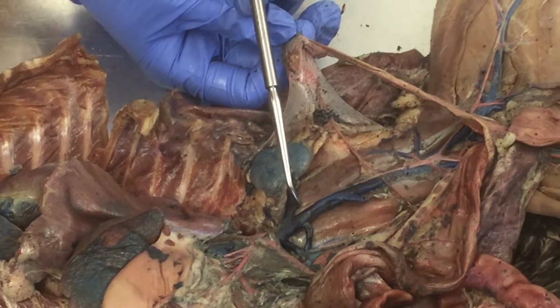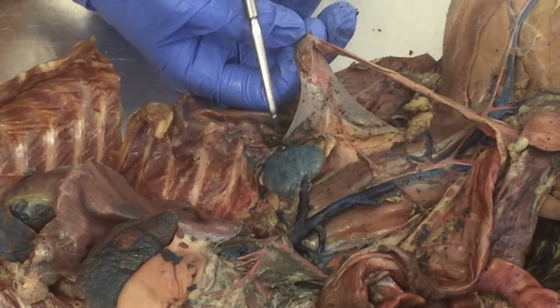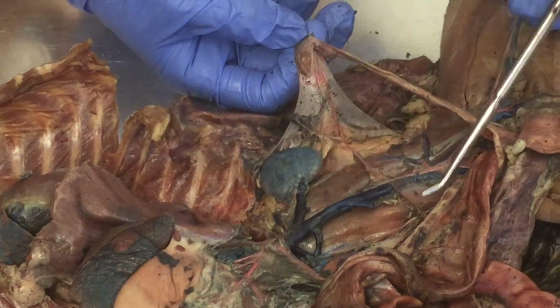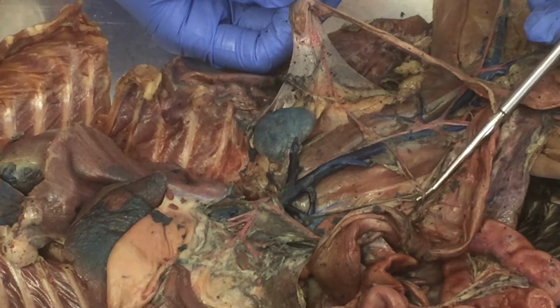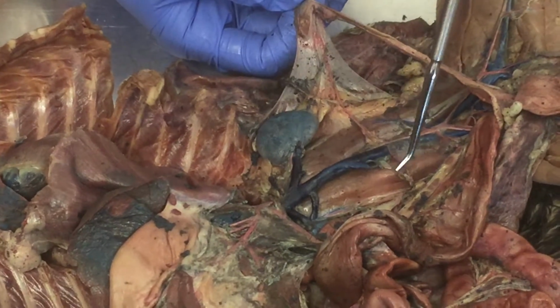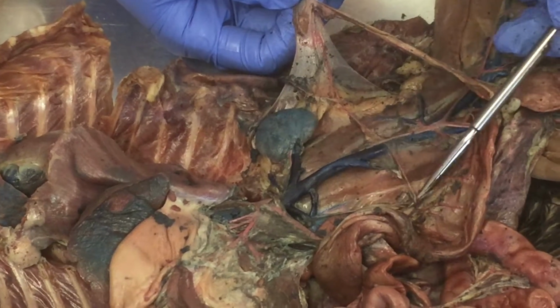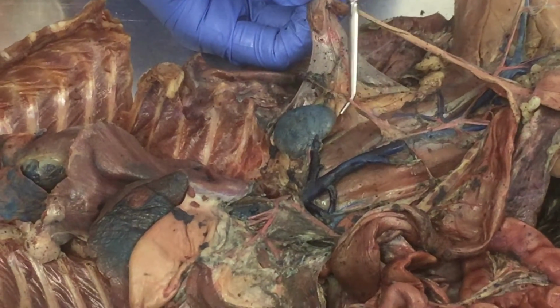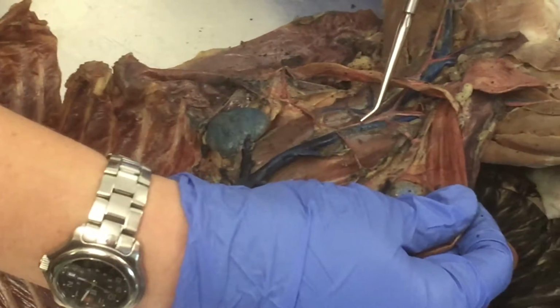It may have come off renal and then come around and followed it. But for my purposes here, I can't really see an ovarian vein on my kitty. So we'll have to see if you guys can find an artery or vein. It might have been this that kind of comes around and follows, because usually they'll follow together. Okay, so that's ovarian.